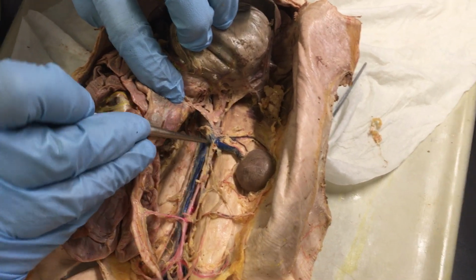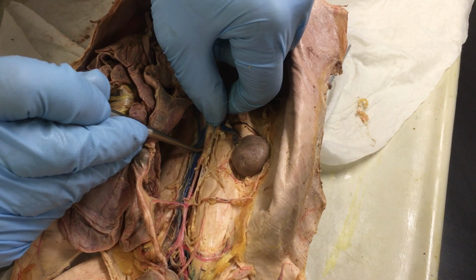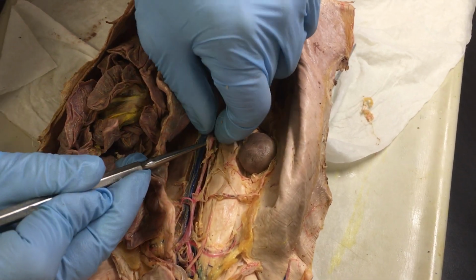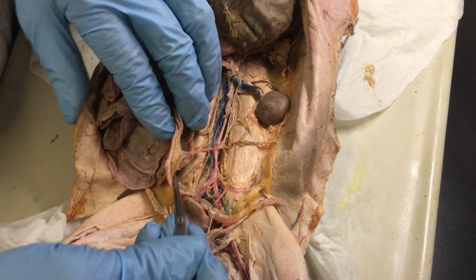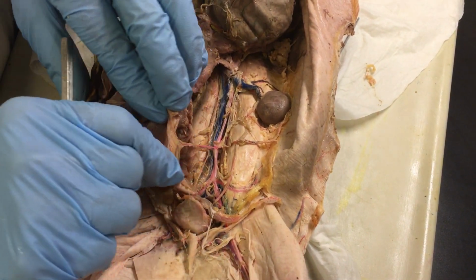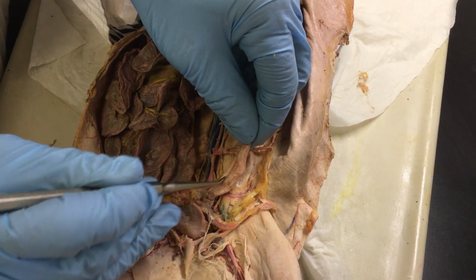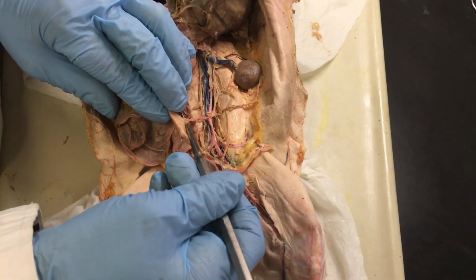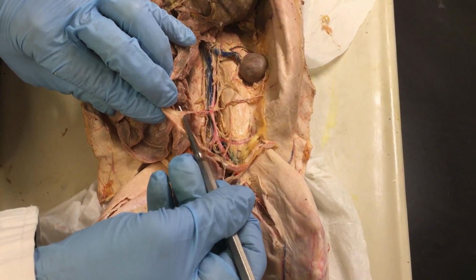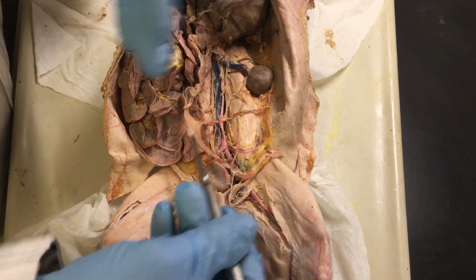And then if you continue with the aorta, there it is. This will branch again now toward other mesenteric in the intestinal area. Here we go. So the mesenteries are kind of peeled off, if you see them here, the membrane. But the branching then, this is called the caudal mesenteric artery. So you see the oxygenated blood that comes from the aorta toward the mesenteric.